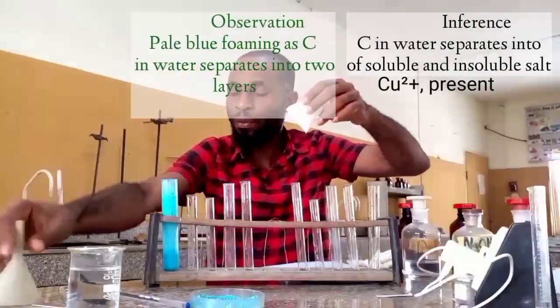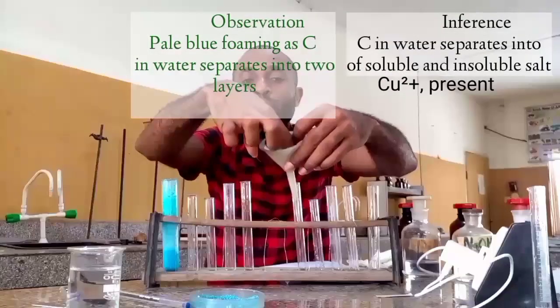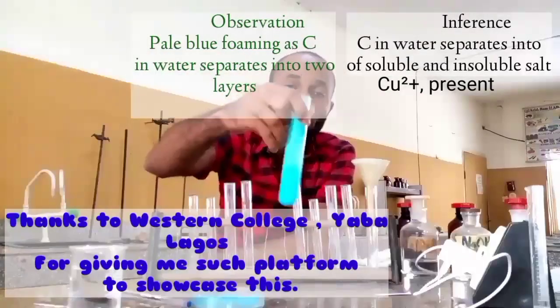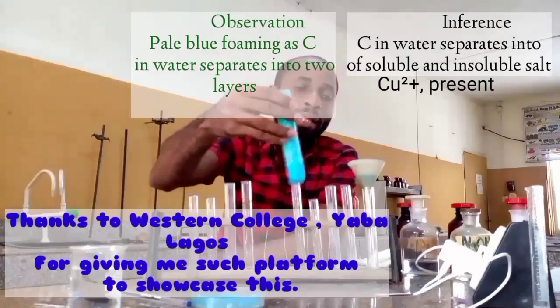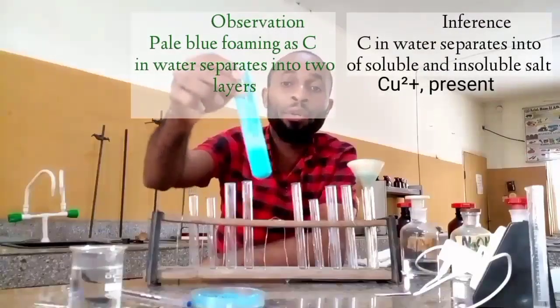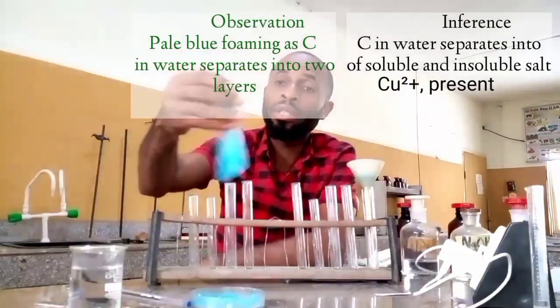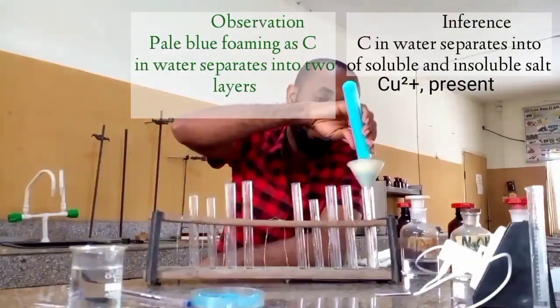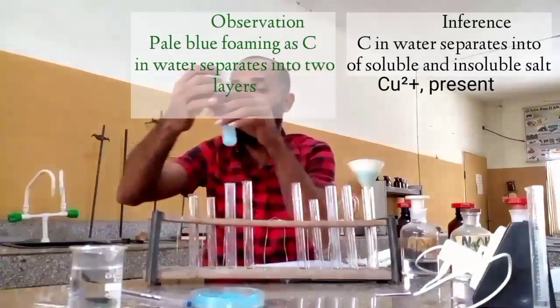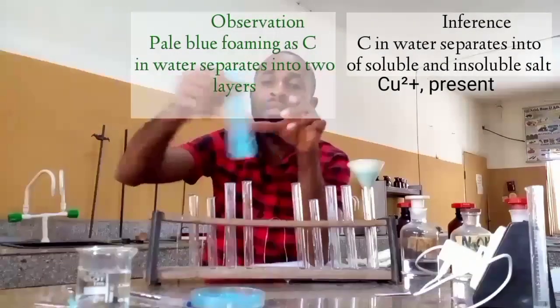Then pick up my funnel, add here, join it together. See, it does not have any hole, it is closed. Therefore, I'm going to pick up this and pour inside here. Although the color generally gave us a pale blue, foams, that's what it gave us here. We are going to wait for this physical separation to occur. I am adding a little of this in order to rinse this.